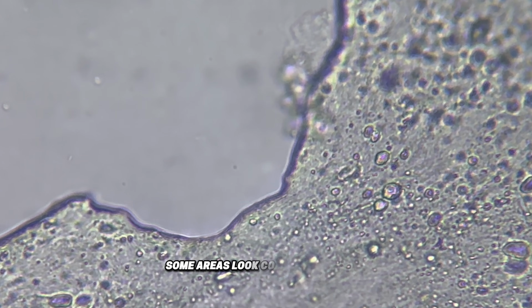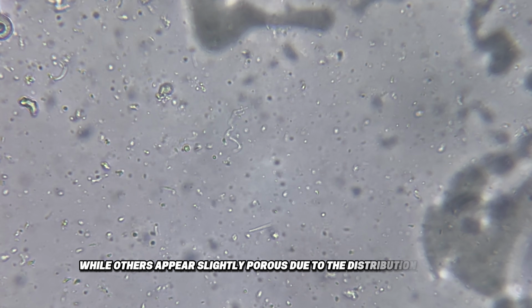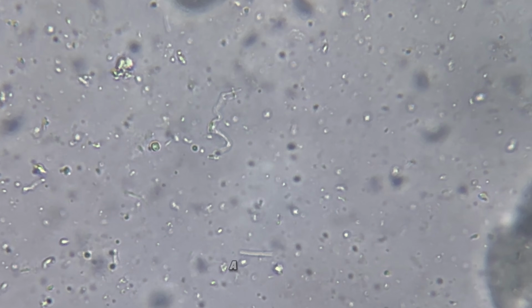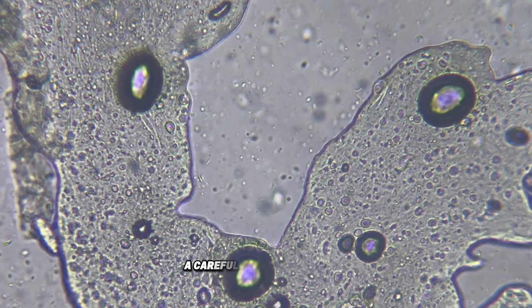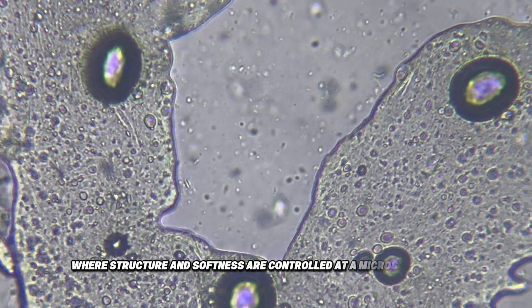Some areas look compact and dense, while others appear slightly porous due to the distribution of fat. This creates subtle variations in brightness and texture across the field. At this scale, sausage begins to resemble an engineered material rather than food, a carefully balanced system where structure and softness are controlled at a microscopic level.